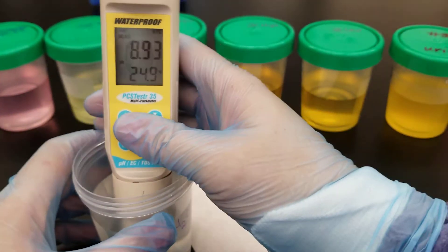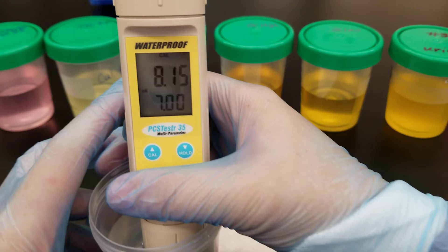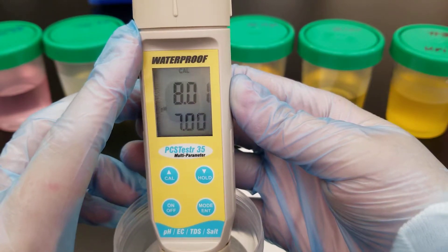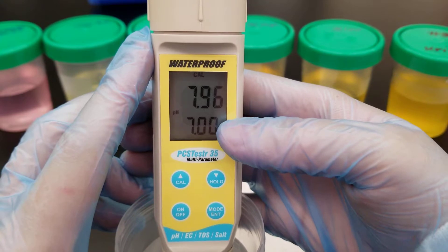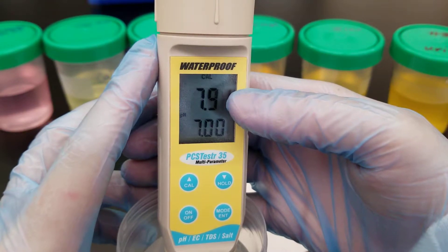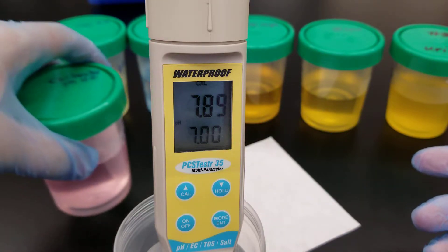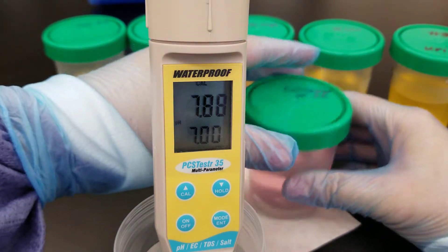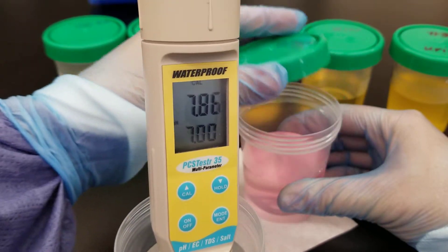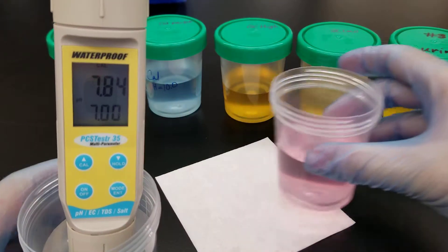I will first put this in water, and now I'm going to hit the Cal button. You're going to see immediately that it has C-A-L at the top of the screen, which indicates it's in calibration mode. The number on the bottom is a previous calibration analysis that was done, and the measurement happening right now is on the top. You can see that the water is basically neutral — that would be seven.